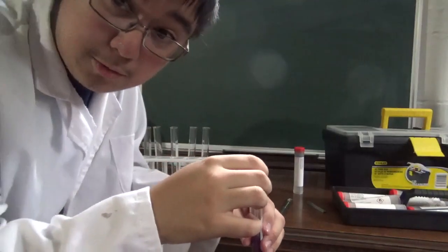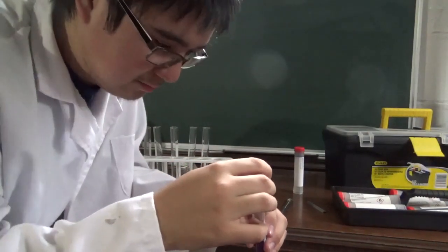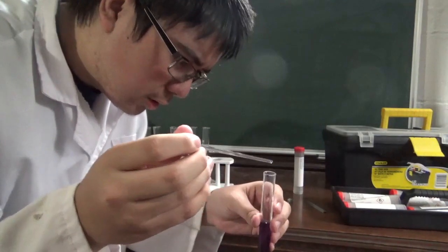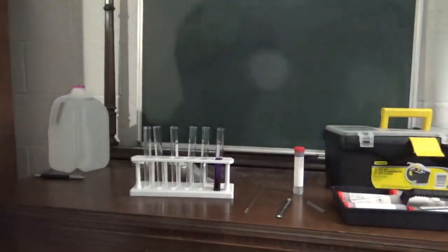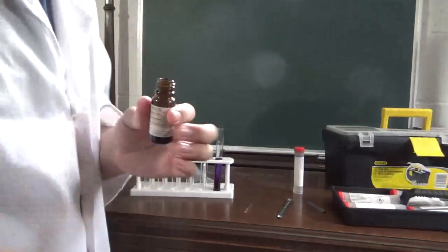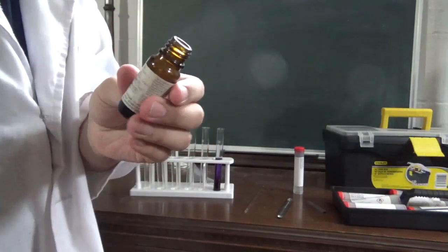Now, if you're a smart human being, you will add denatured alcohol to this solution to improve the shelf life. But we're not smart human beings, right? So we're just going to roll with that. Now we have this which looks to me like it's mostly dissolved, and we're just going to go with it.